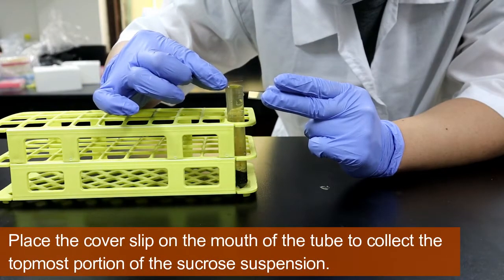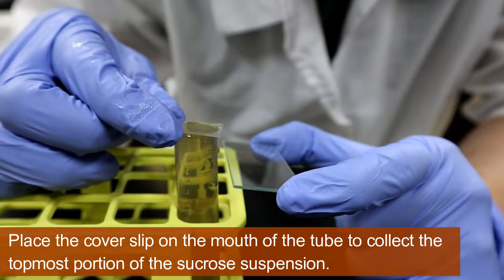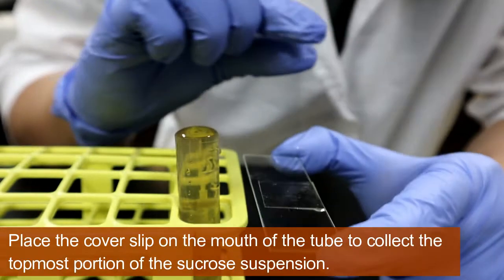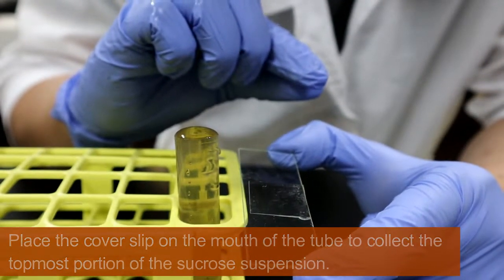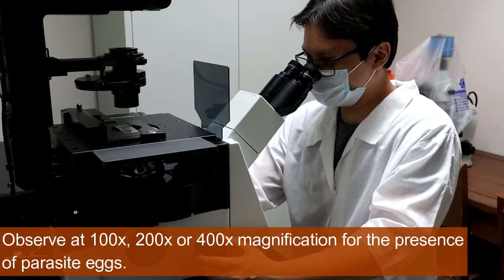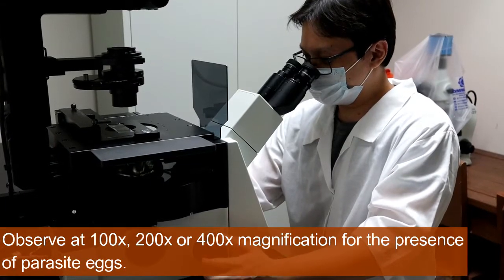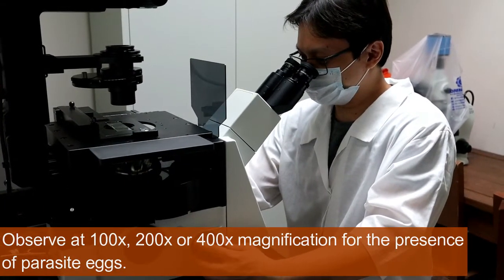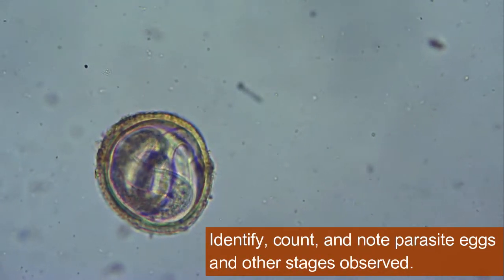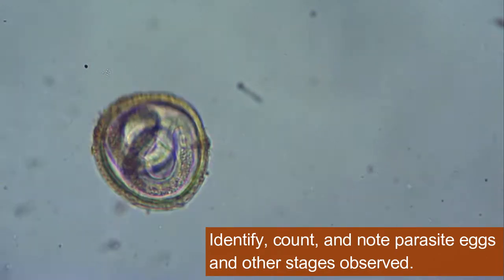Place the cover slip on the mouth of the tube to collect the topmost portion of the Sucrose suspension. Observe at 100x, 200x, or 400x magnification for the presence of parasite eggs. Identify, count, and note parasite eggs and other developmental stages observed.